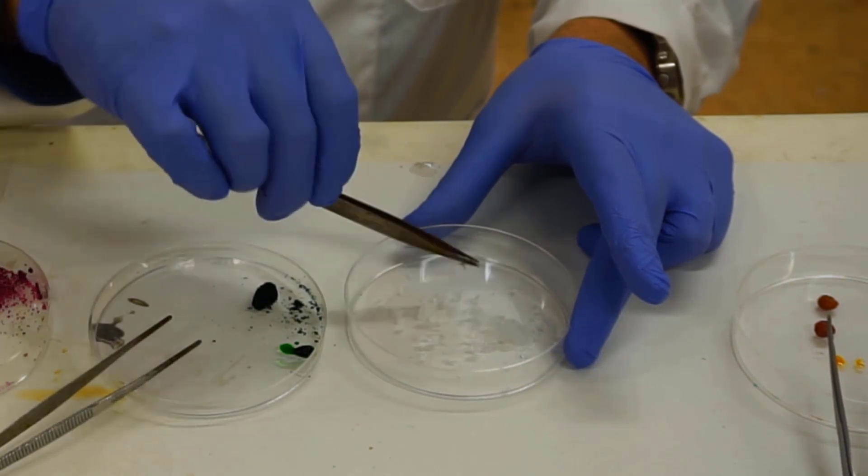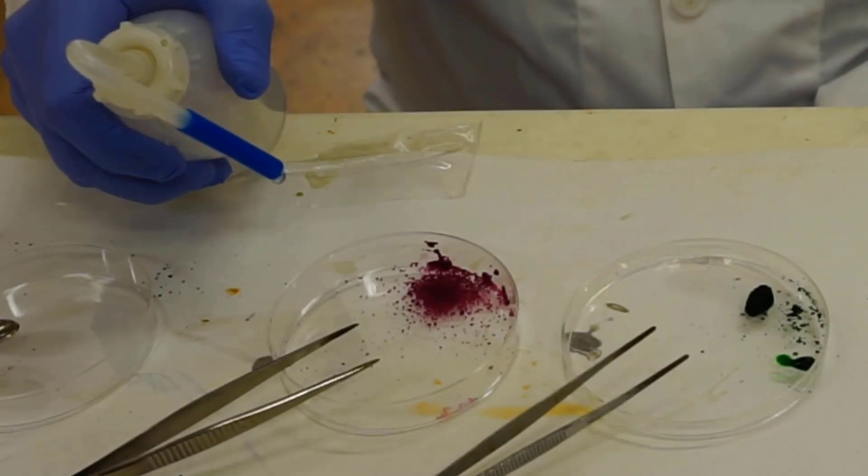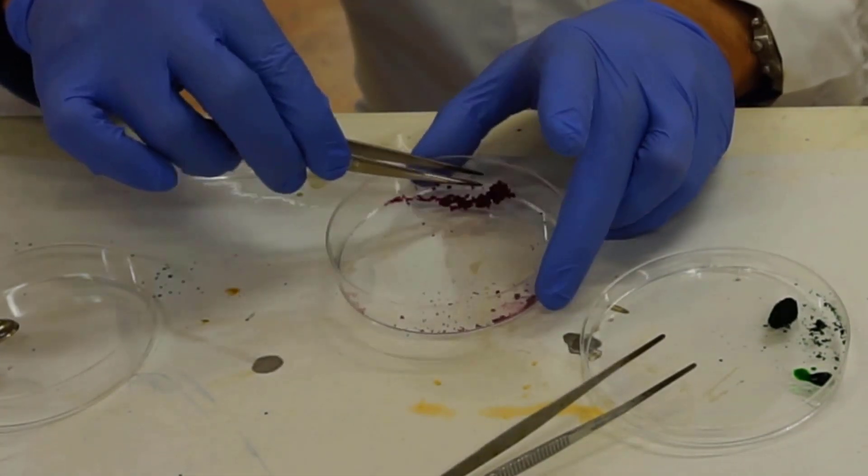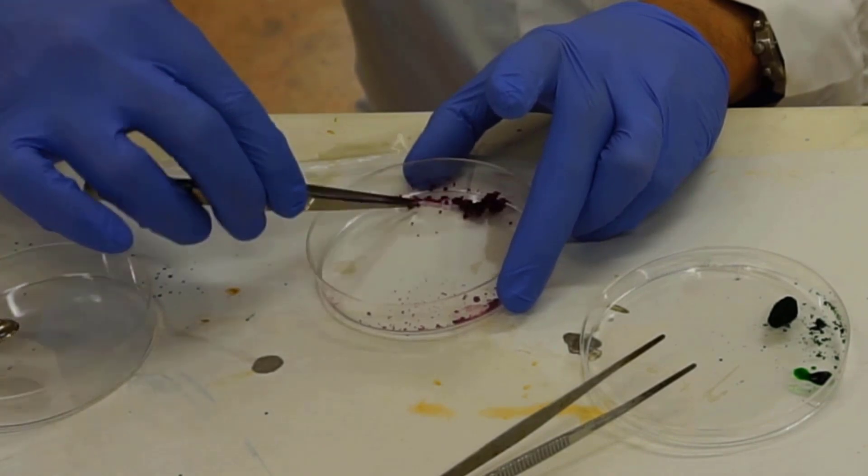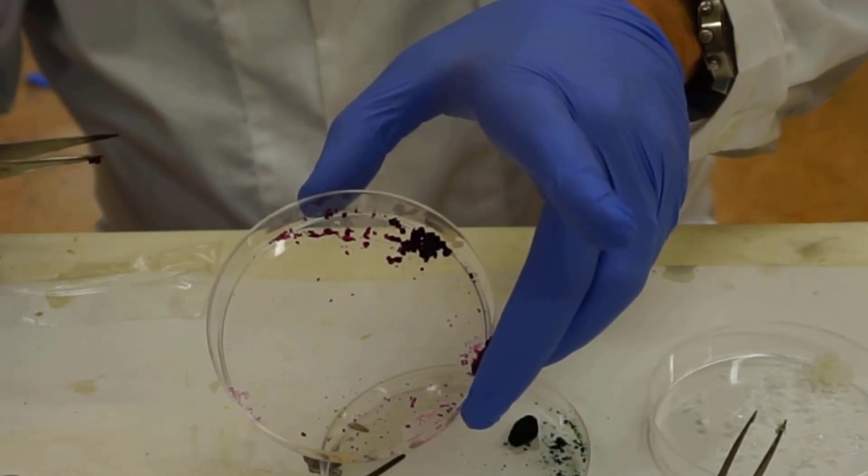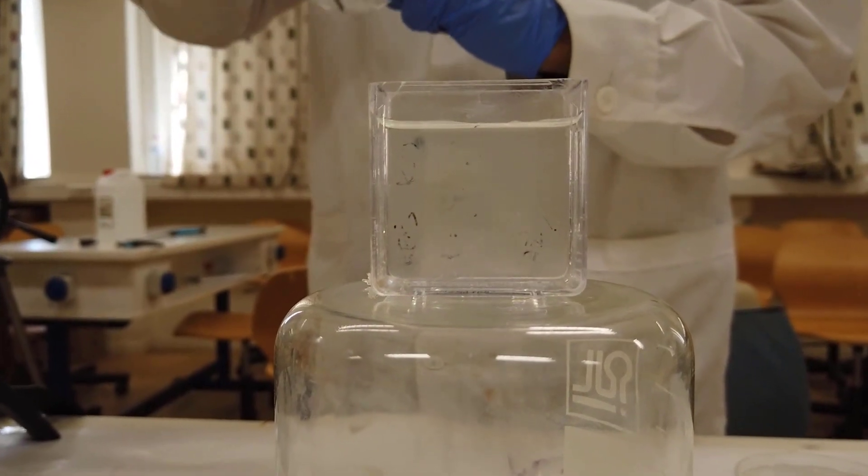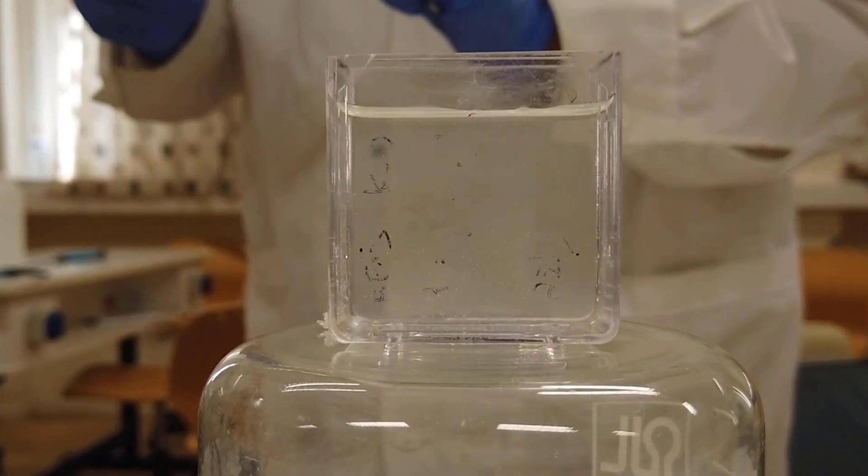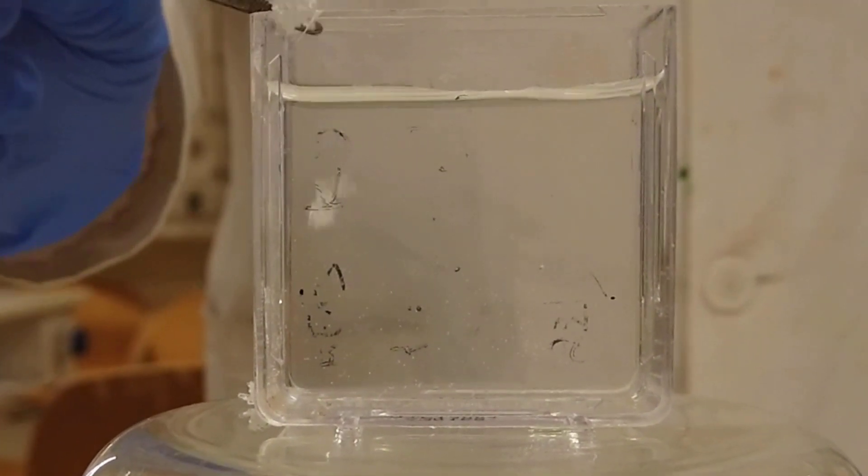For better results, salts were clumped by adding a drop of water and mixing. So let's start dropping the salts in the diluted sodium silicate solution to see what we'll get.